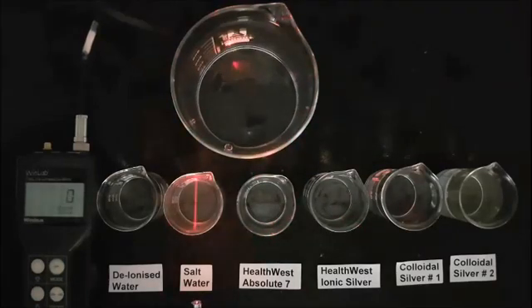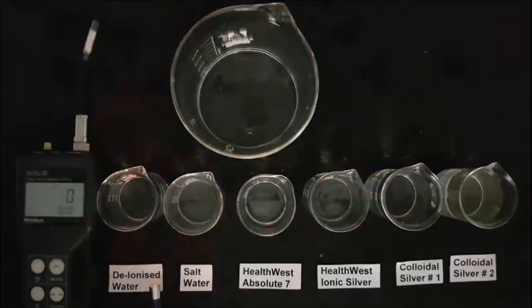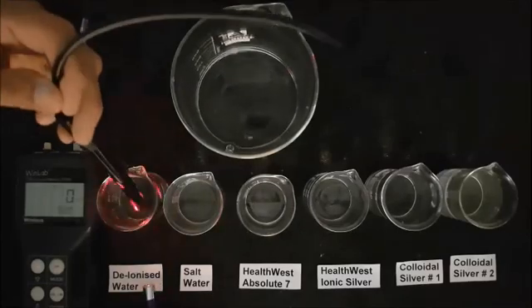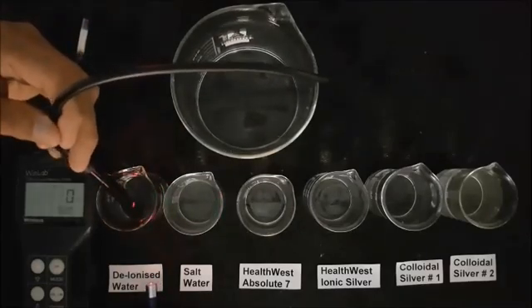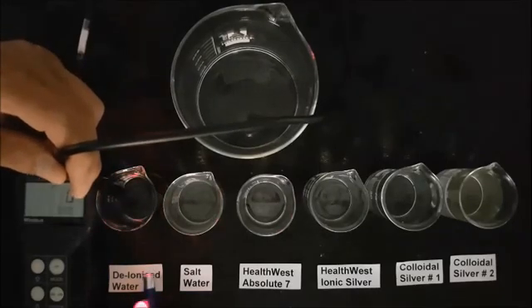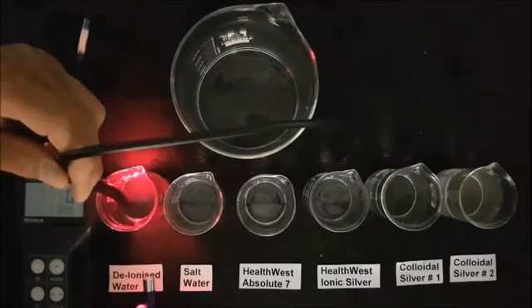This is now contrasted with the deionized water in the first beaker which contains water that has had all the minerals removed and is pure, as can be seen by the conductivity meter which shows a parts per million reading of zero.